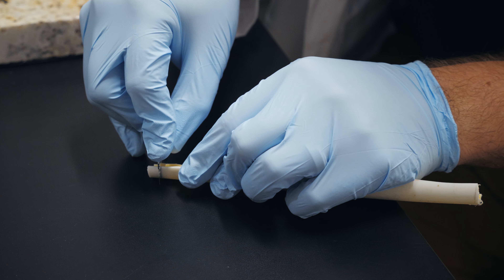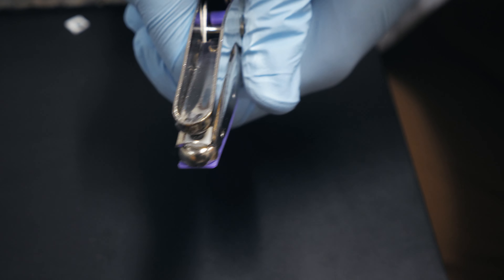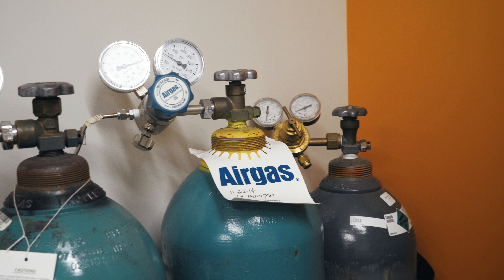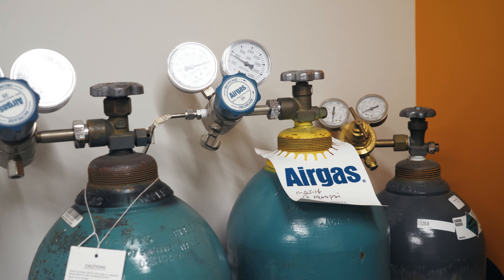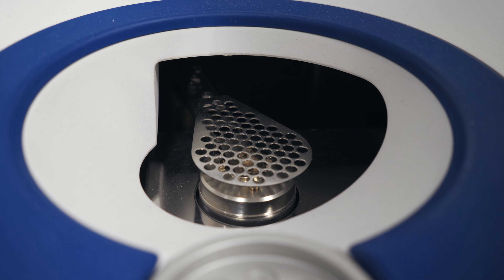To determine the degree of oxidation for a plastic in the DSC, we will cut small samples of our plastic pipe and place them into the instrument. Under a nitrogen or unreactive environment, we then heat it up to a high temperature — a temperature that it wouldn't normally see in field conditions. After it reaches that temperature, we switch it over to an oxygen environment, which rapidly reacts with the plastic. The DSC can measure the degree of reaction that has occurred, which correlates to the degree of oxidation.